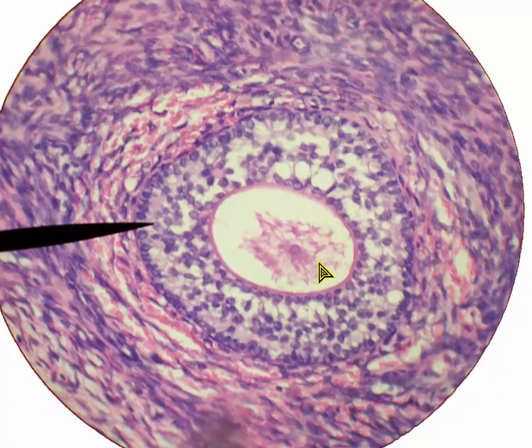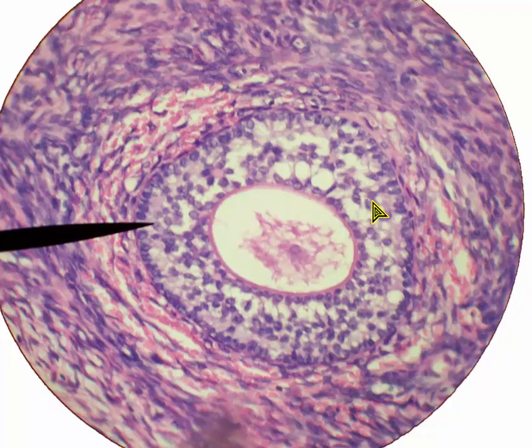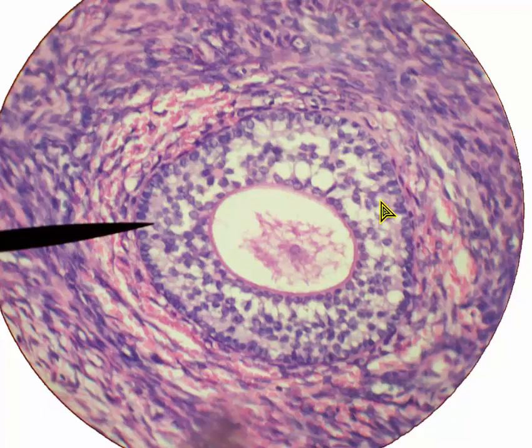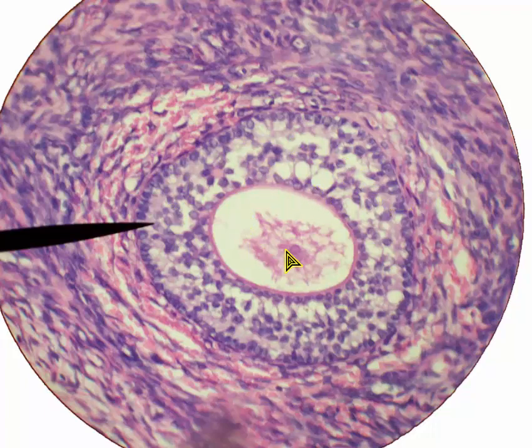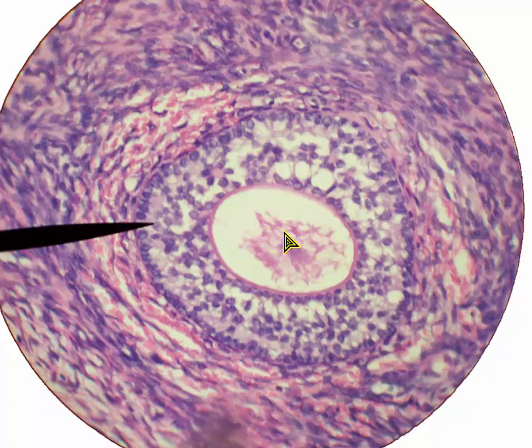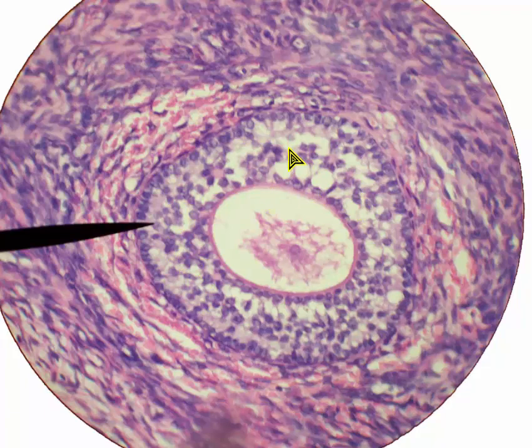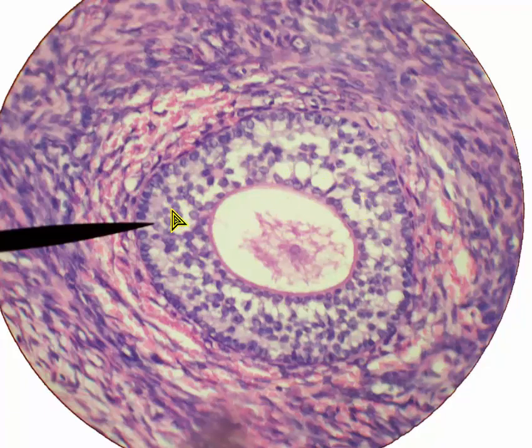Surrounding the ovum or oocyte are follicular cells, also called granulosa cells. The entire structure is called the follicle. This big cell in the center is called the egg, oocyte, or ovum. The cells that surround that oocyte are called follicular cells or granulosa cells. Those are the structures of the follicle.